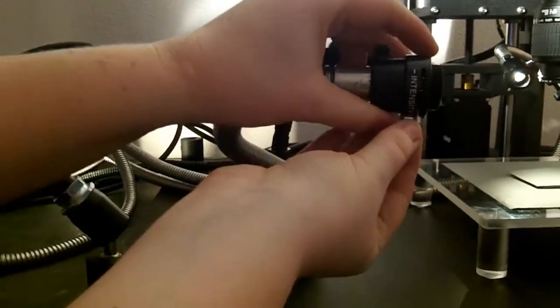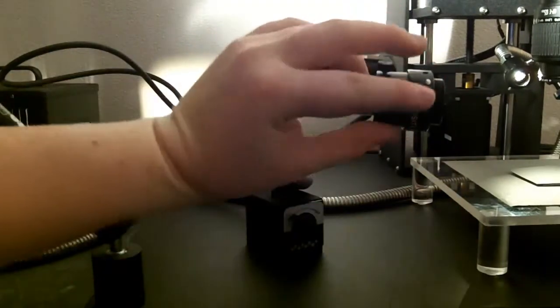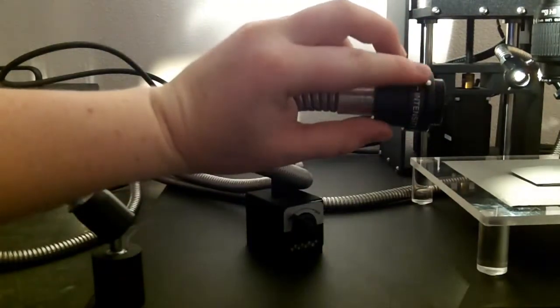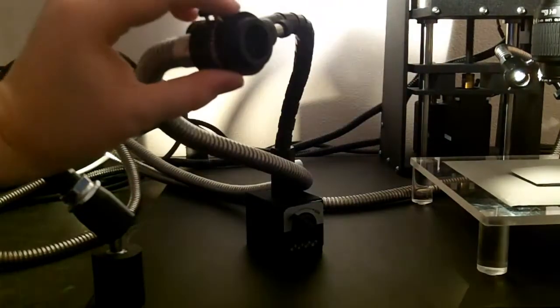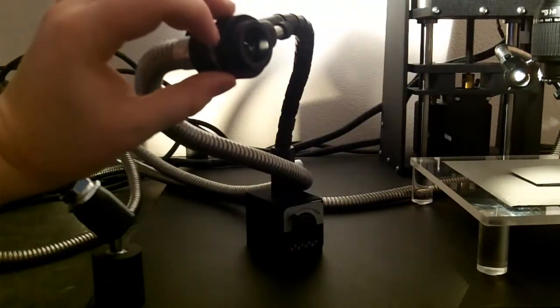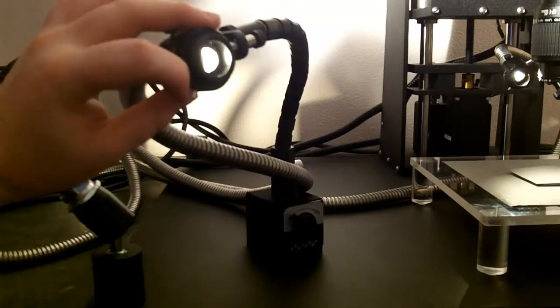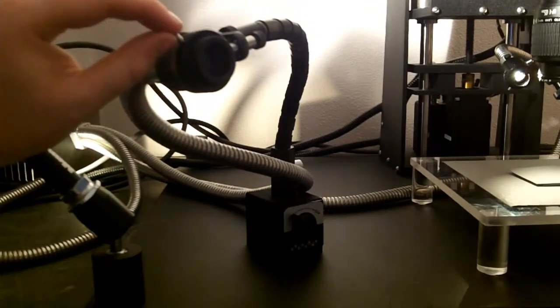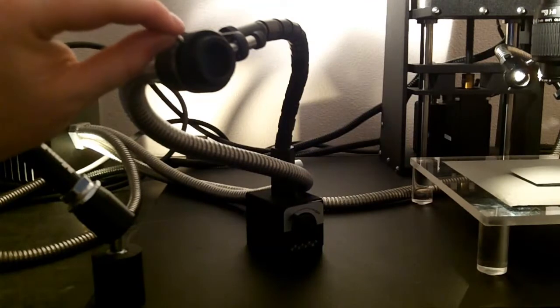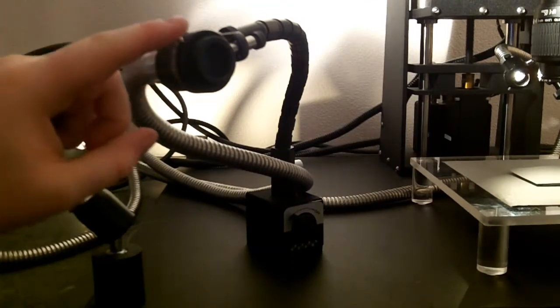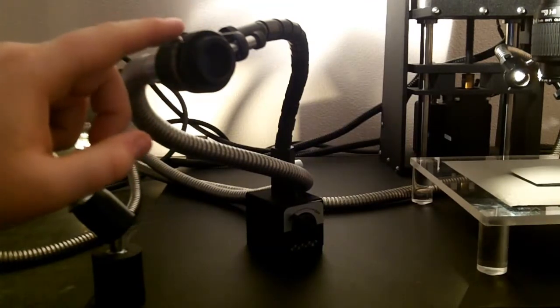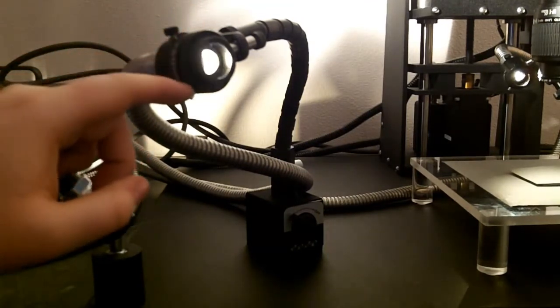Here you can see you can adjust the intensity of light. Here it's the least intense. I'll do that on the side so it doesn't shine directly in your face. As you turn the intensity slider to more intense, more light can shine through.